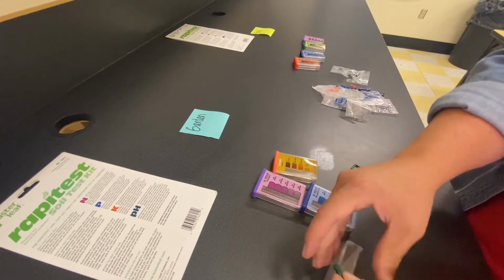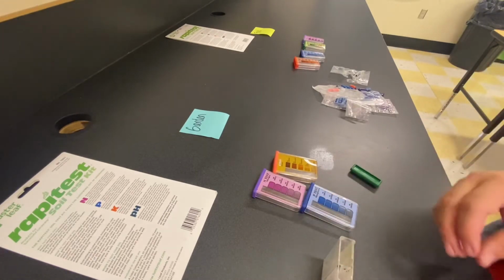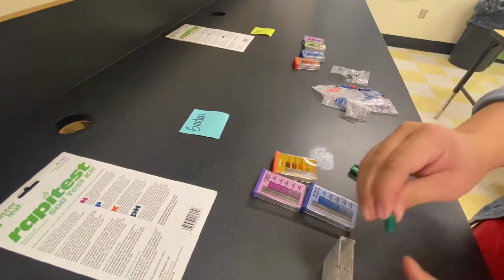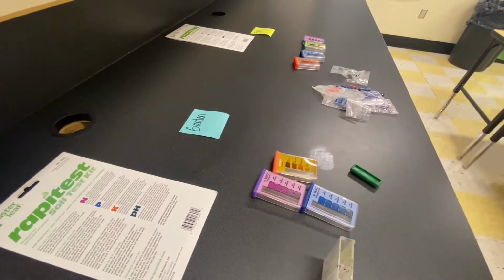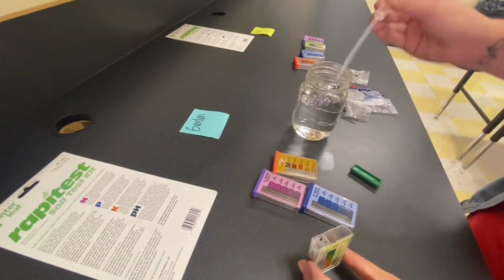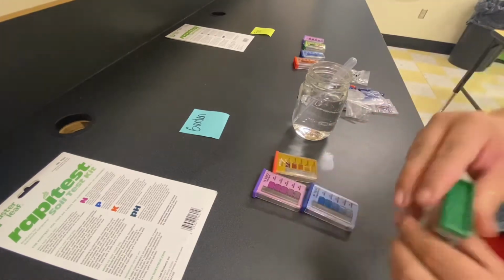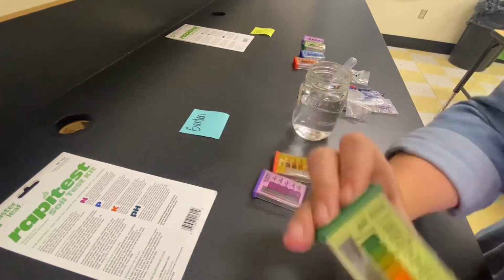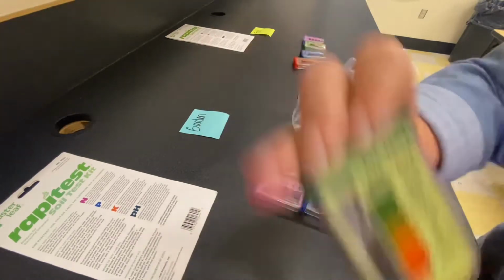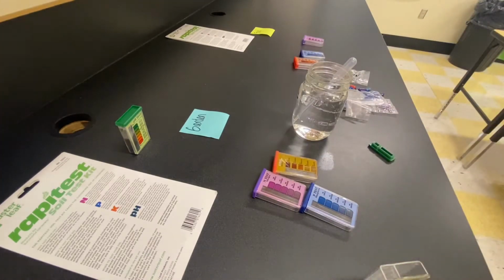When you look up close to these test kits, there's a fill line where you add your water and soil mixture, and then you're gonna witness me drop in a capsule that is color-coded to the test itself. So they're all powder reactants, and they will change color depending on the level of the nutrient or whatever it's testing. So they are all color-coded so you don't mix them up, but they're all powders inside those capsules.